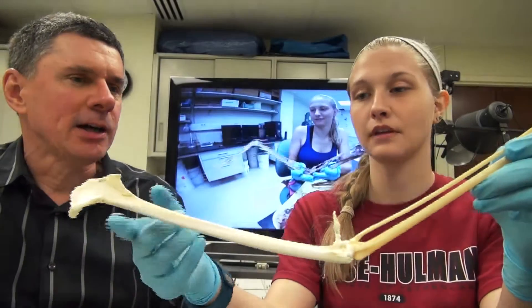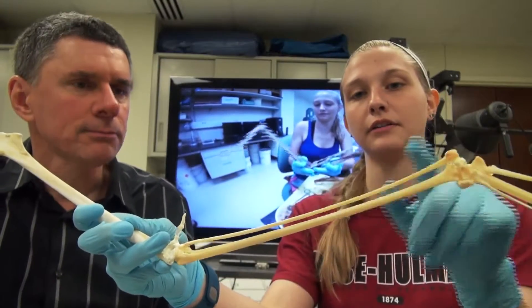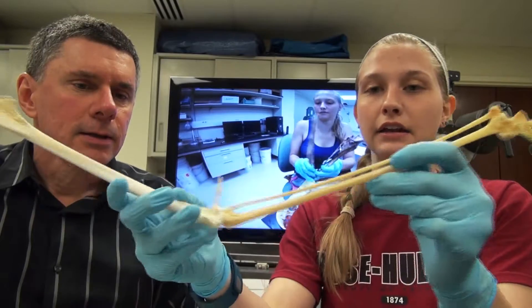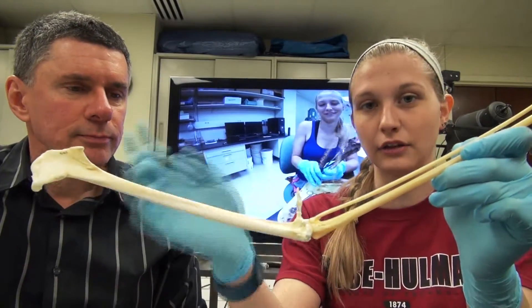Emily, I want you to run us through the osteology here. So here you have the humerus, and then you have the ulna and the radius, and then you have the carpometacarpus which kind of encompasses the wrist and then the hand of the bird. And then another bone we found that we weren't really expecting is this little tiny bone right here that we call the cubital ossicle.